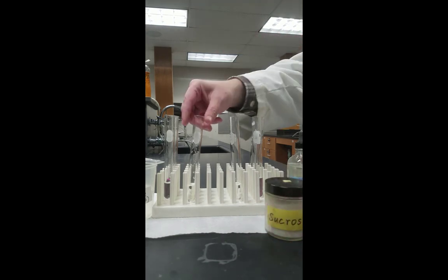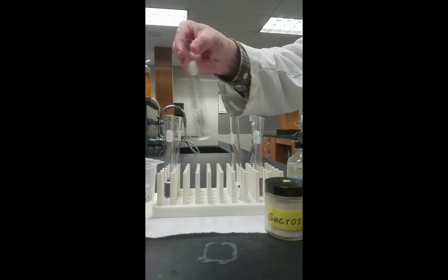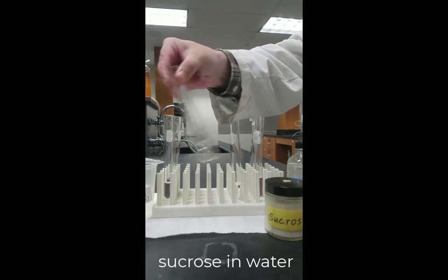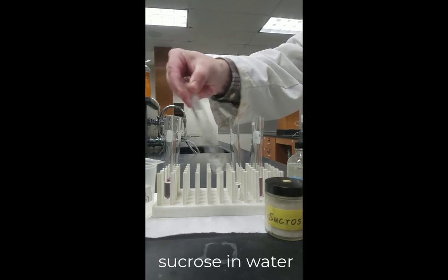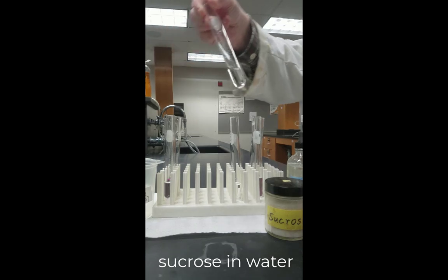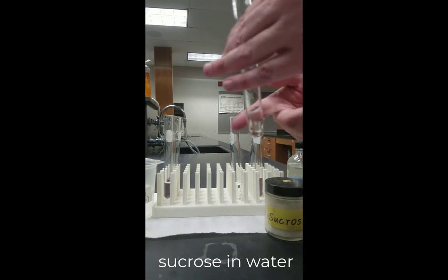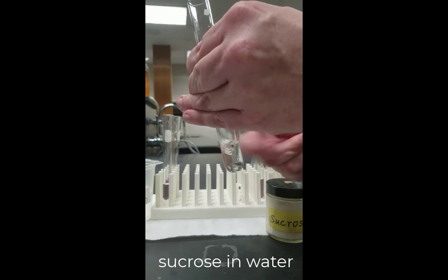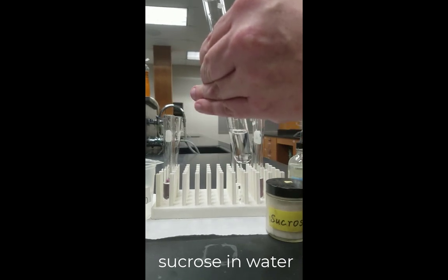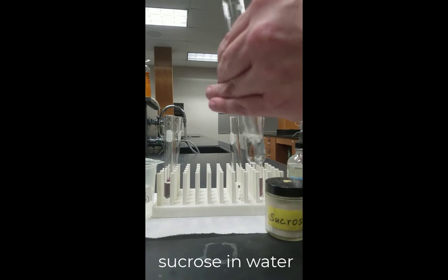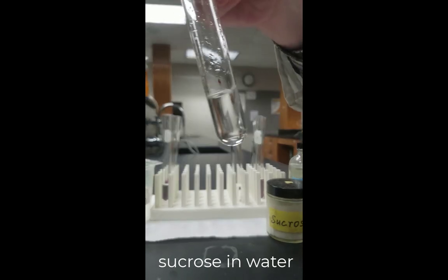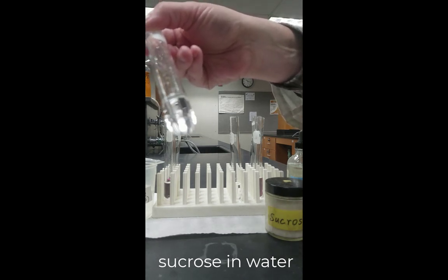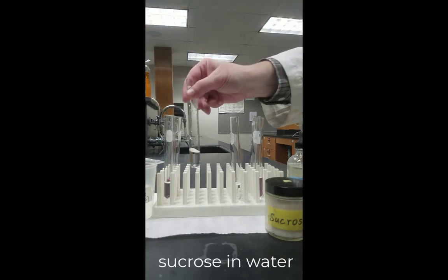So the test tube on the left contains water. Now with the sucrose in it, we'll shake that. And now we'll give it a really good shake, just to make sure. And you'll notice, if you look towards the bottom of the test tube, that virtually all of the solid is gone. It has dissolved.